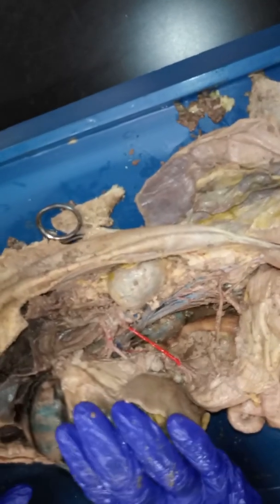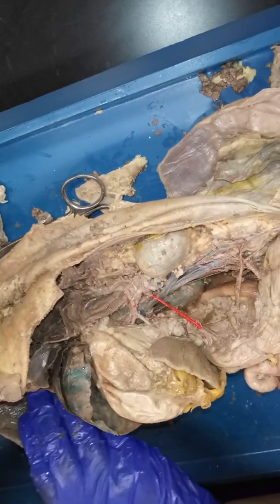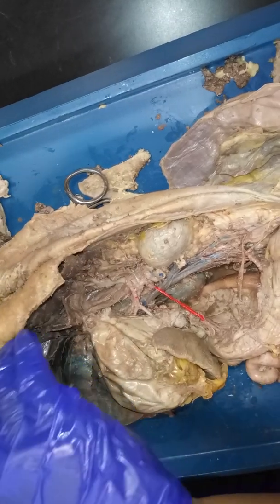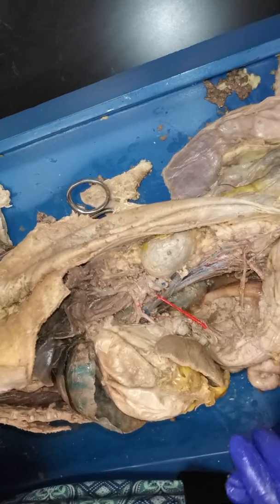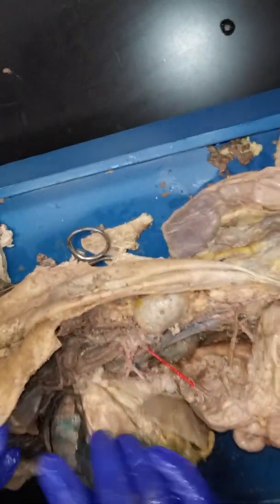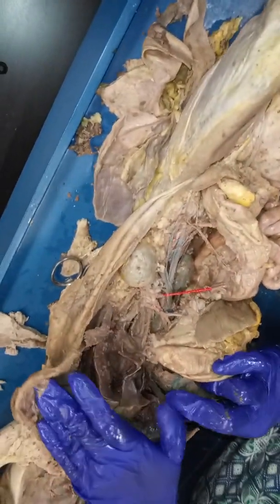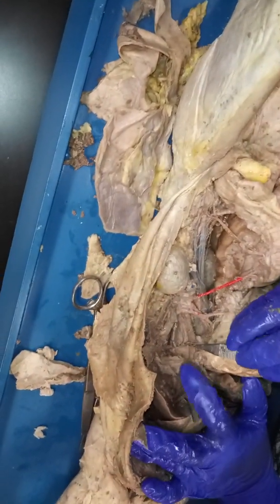All right, okay. Because none of our cats have been able to get a really good thoracic region, okay, enough to be able to name enough, then I'm going to go over the abdominal region, the abdominal vessels. And just for reference where we are, we're going to start with the aorta. The aorta was kind of difficult to find here, but we want to look for where those branches are that are coming from the aorta.